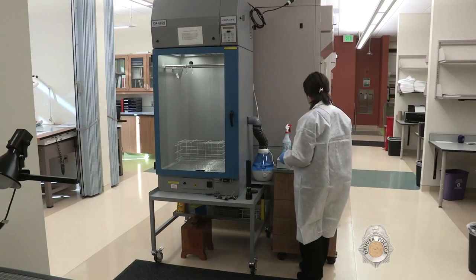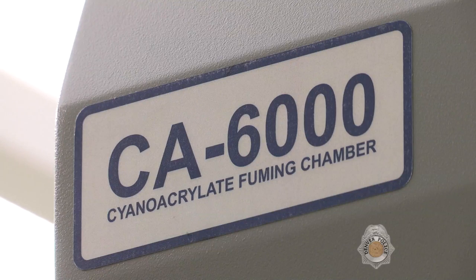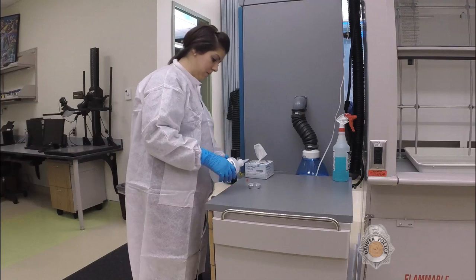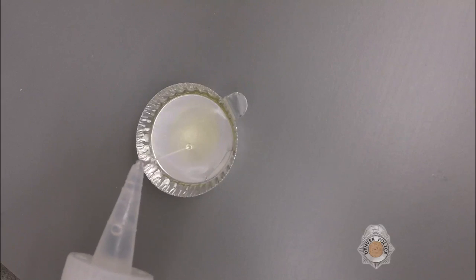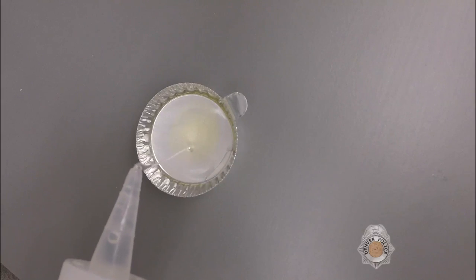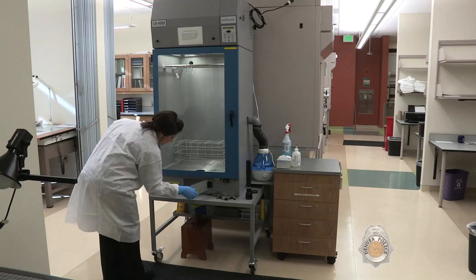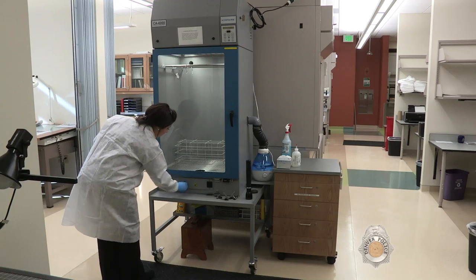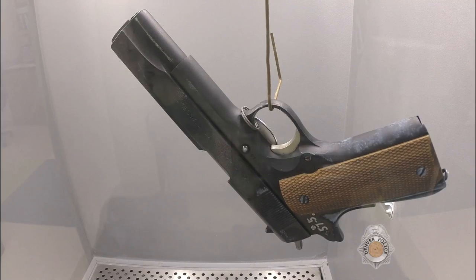One of our main tools to develop latent prints is the cyanoacrylate fuming chamber, also known as a superglue chamber. A small tray of superglue is heated until it becomes a vapor. Humidity is added to the chamber, causing the vapor to adhere to any latent print residue an individual may have left behind.